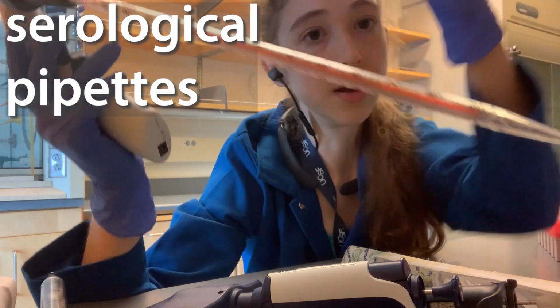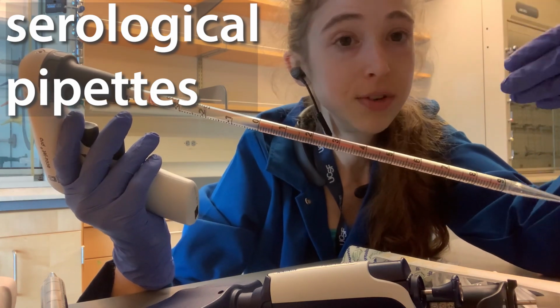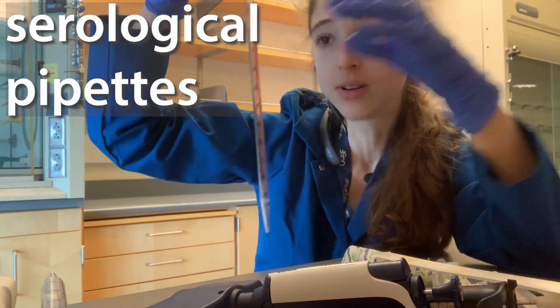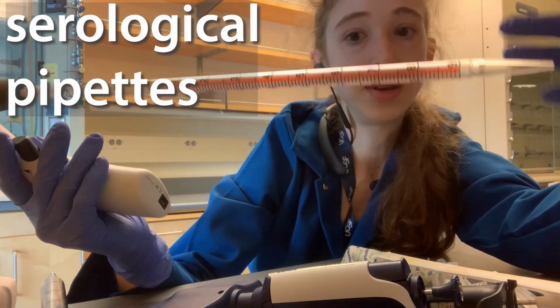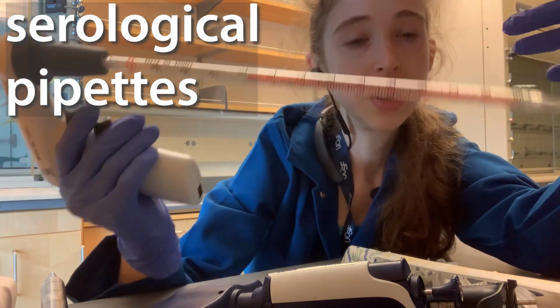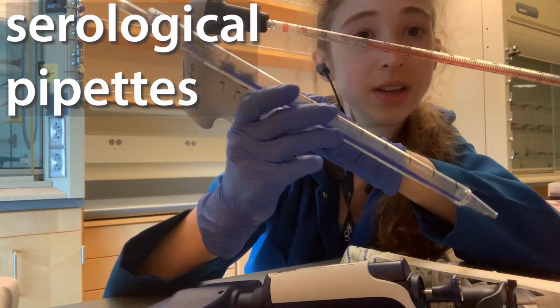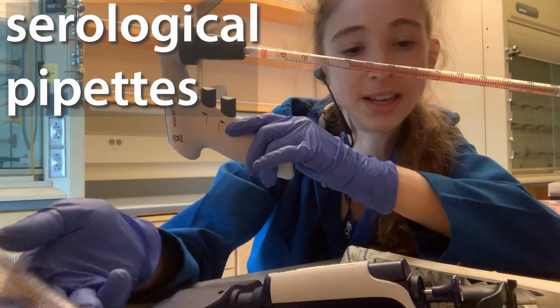But speaking of good enough, often when we're doing things, we have to think about, okay, how much do I really need that extra precision? If you don't need that extra precision that much, it's okay to just eyeball it like that. But if you do need the precision, then you really want to make sure that you're measuring correctly and say, okay, maybe I should use the smallest pipette that I can use. Whereas if you're just trying to transfer liquid from one place to another, you really don't care that much about the accuracy, and maybe going in 1 ml portions is good enough for you, and you don't even need to eyeball it that accurately. It's really good to know what each step in the experiment does, and then you know when it's okay if you're not as precise, or when you need to be really precise.